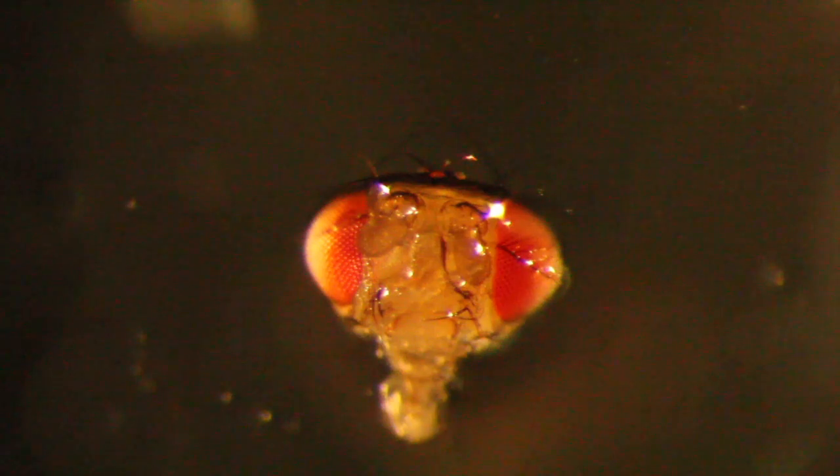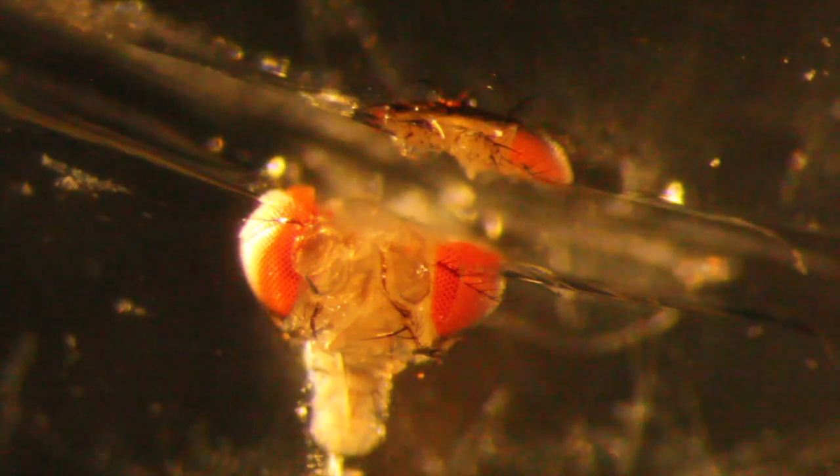Remove the strip of cellophane, add a drop of water and cure for 1 minute. After curing, wick off the water with a tissue, apply a drop of saline and cut approximately along a line through the dorsal third of the second antennae segment. After trimming the section, mount as shown previously.